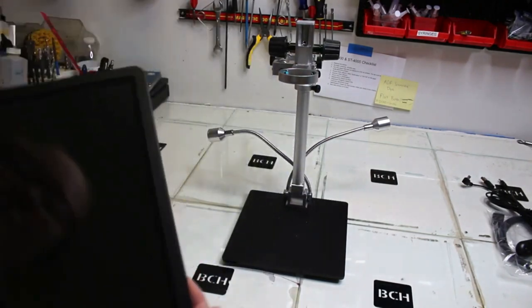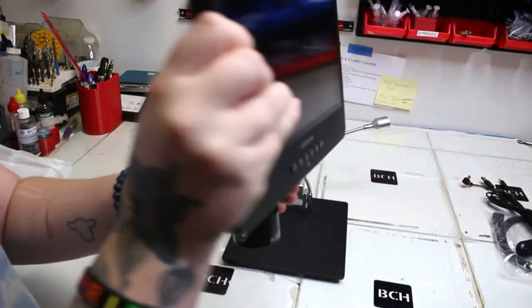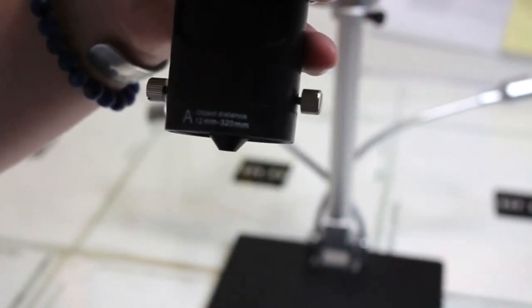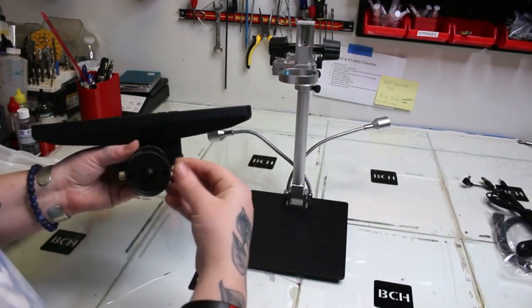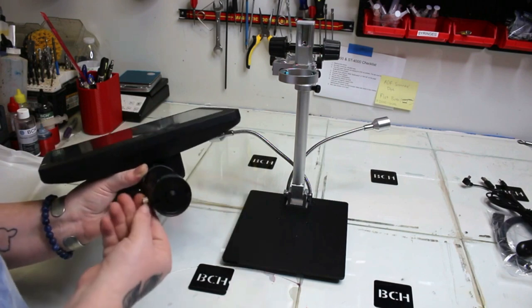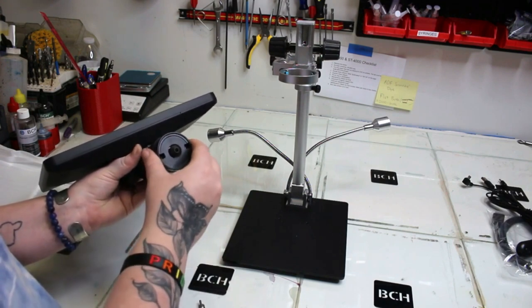Here is the microscope with the microscope host. The microscope itself is positioned facing upward, so you need to carefully bend it down so it would be looking down at the black base. Lens A is already on. You cannot lower it down into the boom arm with the lens on, so we need to unscrew the two screws to the lens — don't lose these screws, it's important. Be careful with them and set them down somewhere you can see them.